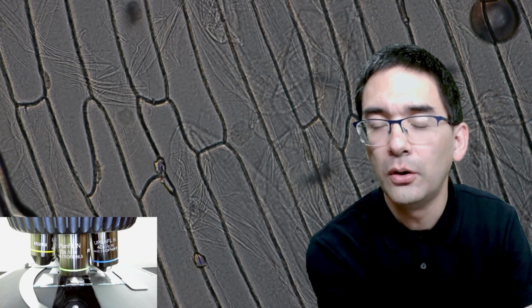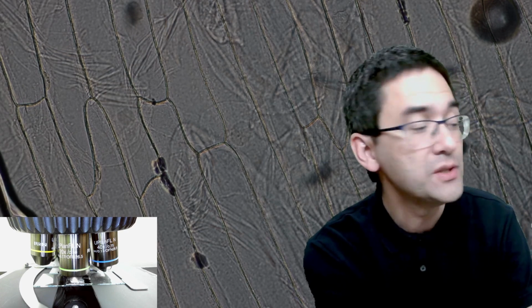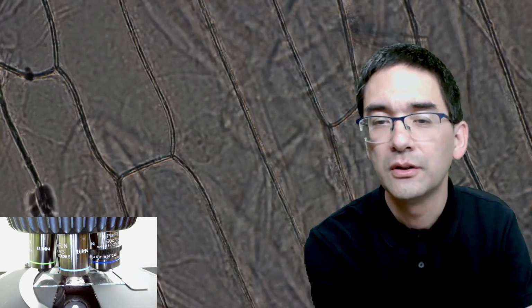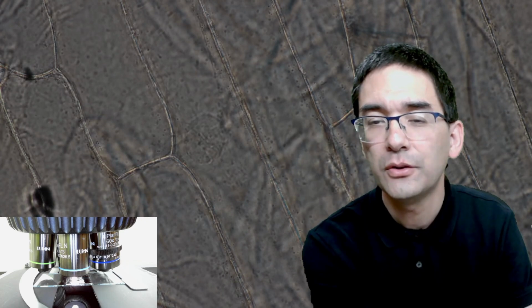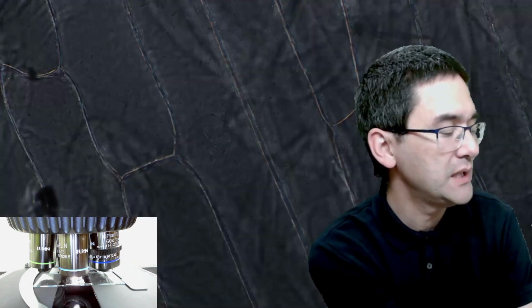Of all of those things like chloroplasts, we don't have a large central vacuole here, at least we don't see it. The cell wall is the only thing that I'm able to see here. That's why I've made a video later on to show you a little bit more. Now this round structure over here, almost in the center, very difficult to see, that is the nucleus.